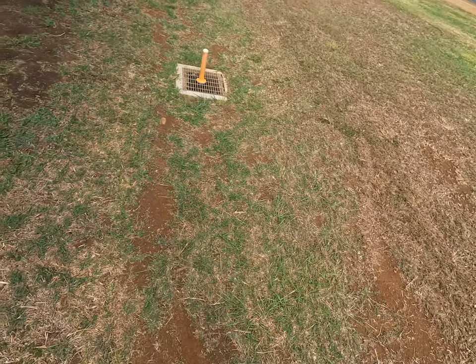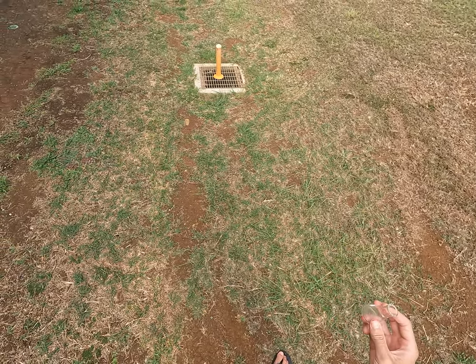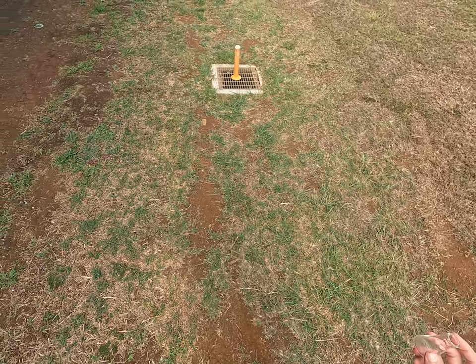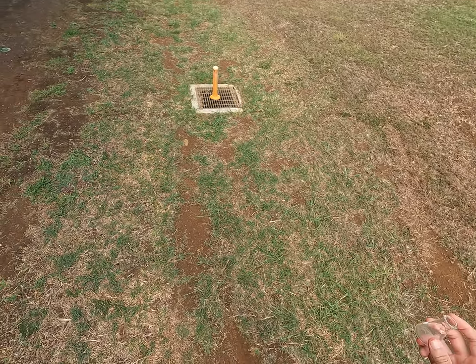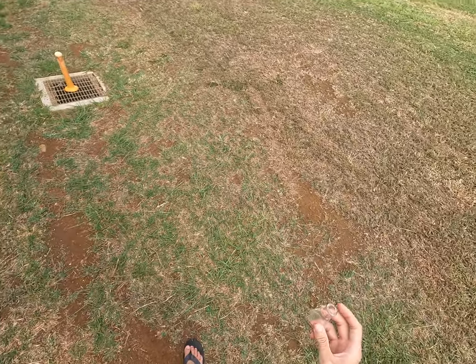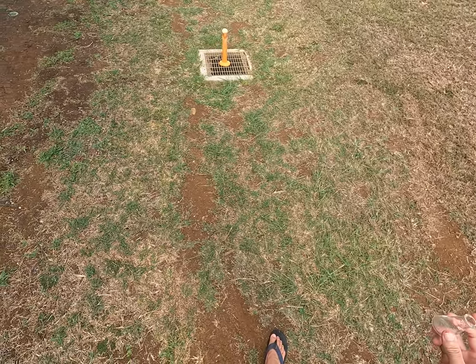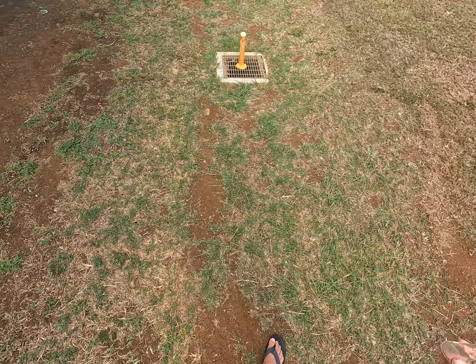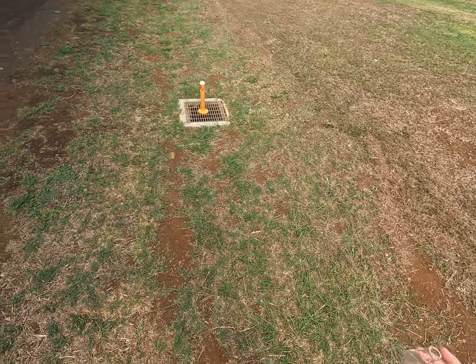This is called the elephant toothpaste reaction. It's very slow. There are famous examples on YouTube of ones that go very much more quickly — we might watch one or two of those. I'm going to stop recording and we can go back inside.